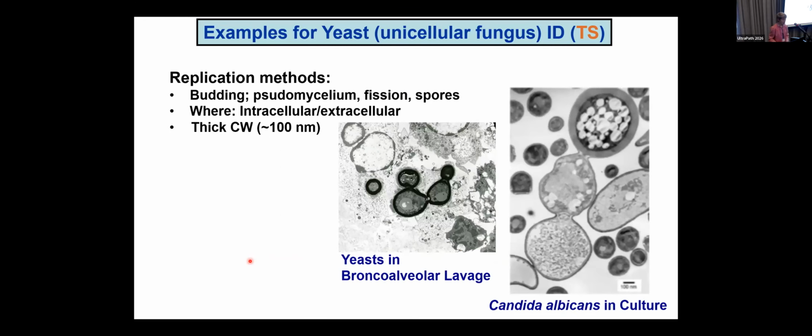Here are examples of higher organisms. Yeasts are unicellular fungi. It reproduces by budding, as you can see here. And where is it? In the nucleus? Probably not, but in the cytoplasm or extracellular. And it does have a thick cell wall. Now, I took this picture in graduate school. This is in my dissertation. So that tells you that it is an ancient picture, but it's still relevant today. These are the yeast cells. And you can tell that this is the pseudomycelium and a spore that this yeast can make. And you can see how thick that cell wall is.